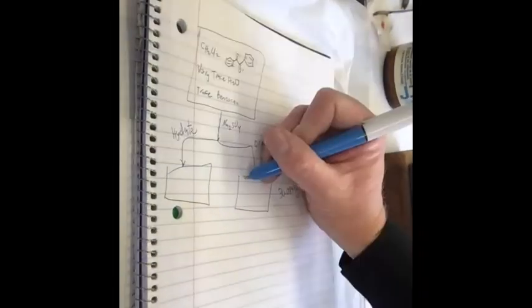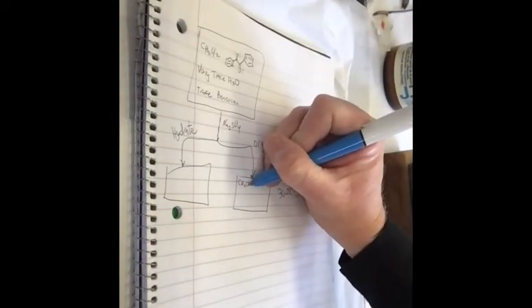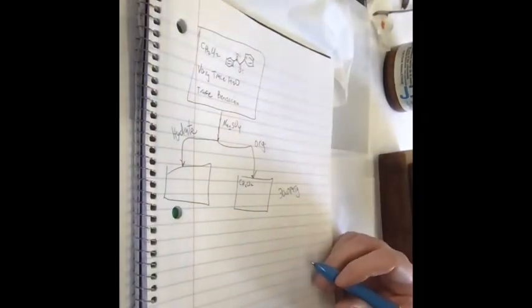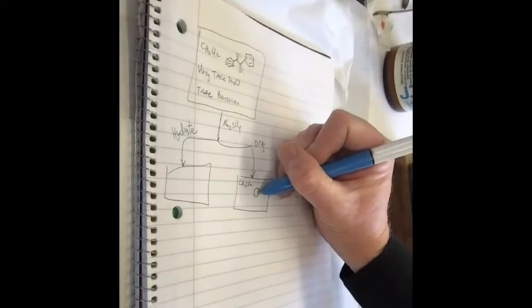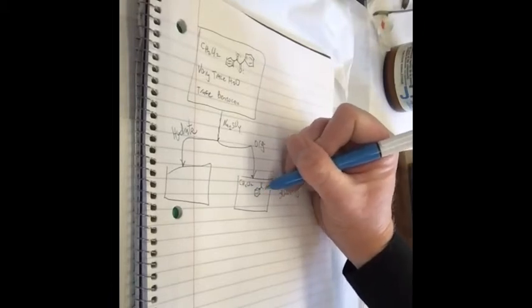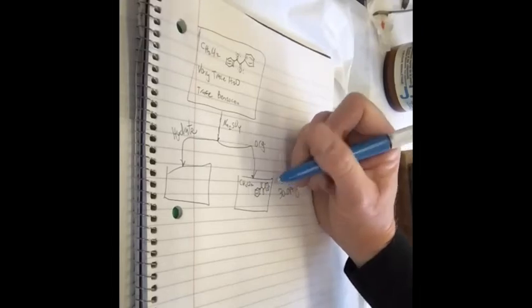So what's in the organic layer on the right now? Mostly methylene chloride. Can you guys hear me? Yes. Good. And the benzil. And let's say we got rid of all the water.